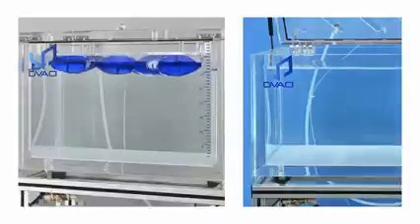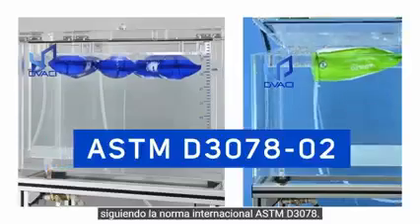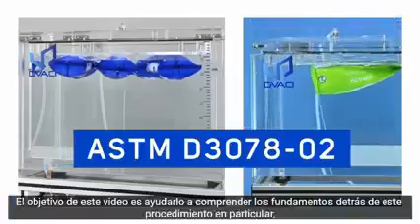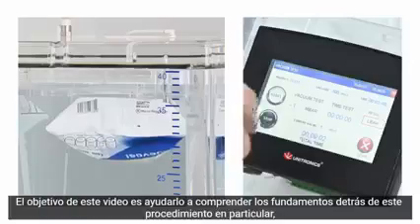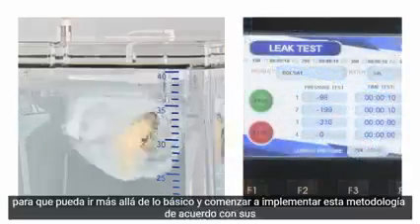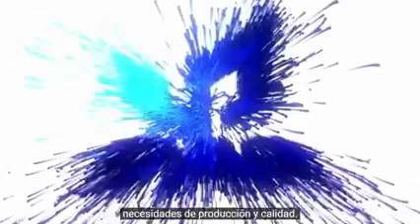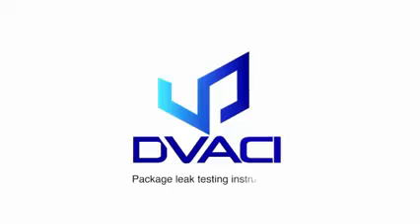This is a leak test by bubble emission, following the ASTM D3078 international standard. The objective of this video is to help you understand the fundamentals behind this particular procedure, so you can move beyond the basics and start implementing this method according to your production and quality needs.